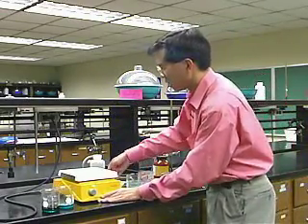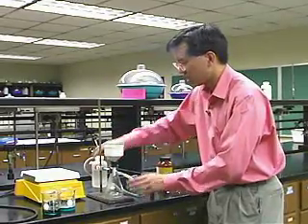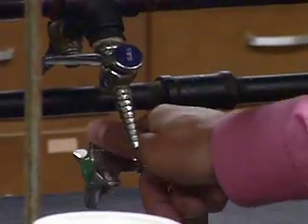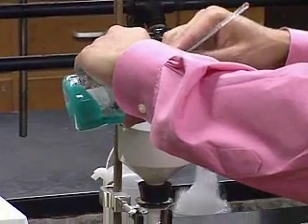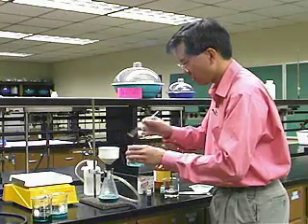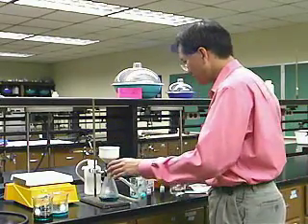The way you collect crystals after you do a crystallization is by a vacuum filtration. Here I have a vacuum filtration apparatus. It's a vacuum filter flask with a Buchner funnel and a piece of filter paper placed inside to cover the holes. We collect by pulling a vacuum on it. So you turn on the vacuum, then you wet the filter paper, and then you start collecting the crystals. Now what I'm going to do is wash the crystals with a little bit of water. Let me stop it right here and show you what it looks like.